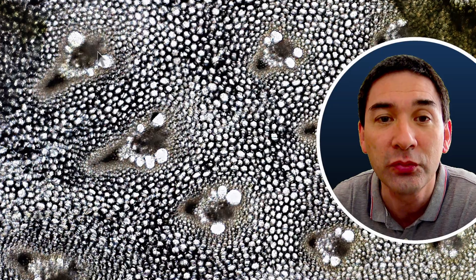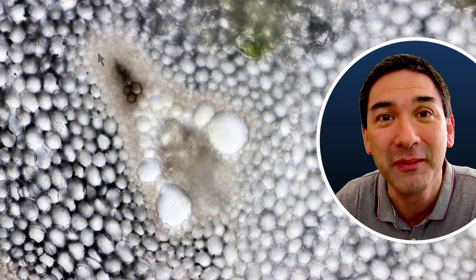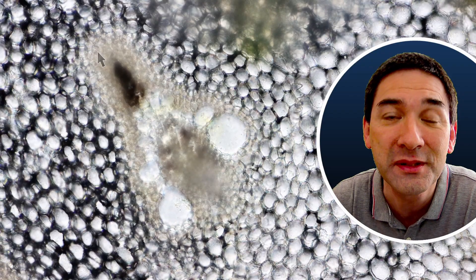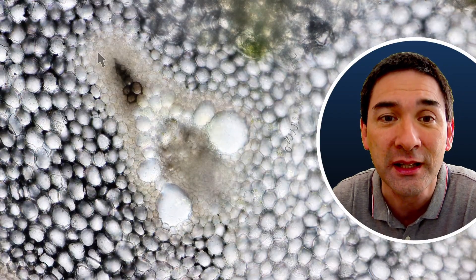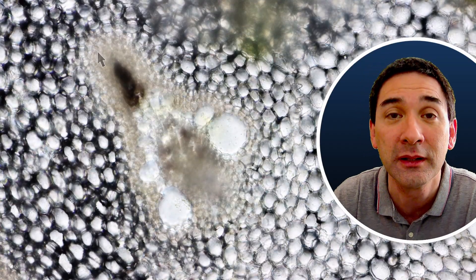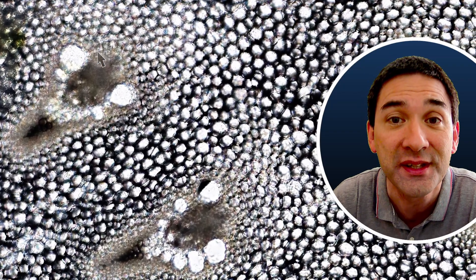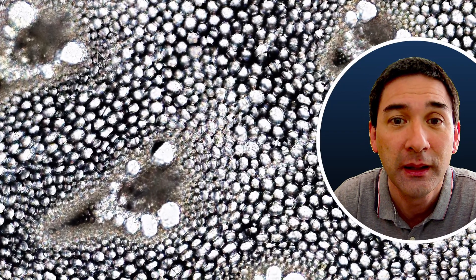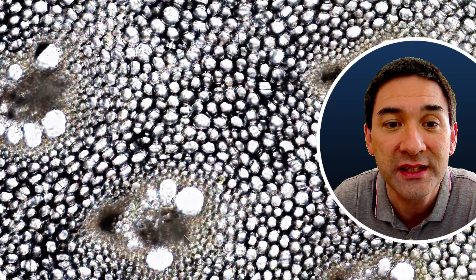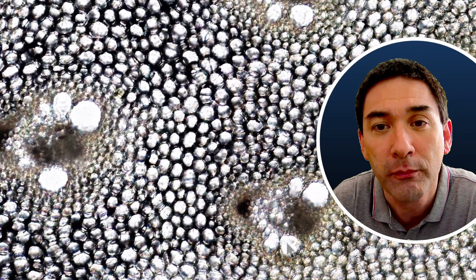Simply by looking at this I can confirm what I already knew: the asparagus is a monocot plant - it has one single leaf when it comes out of the seed. The reason I know that is simply by the way these vascular bundles are scattered throughout the stem, as you can see here. The vascular bundles are scattered all throughout the stem, and that is a typical arrangement of a monocot plant.